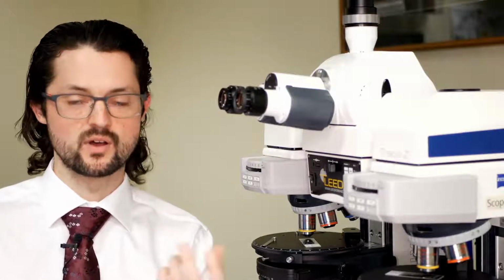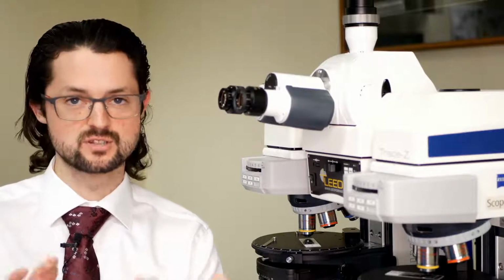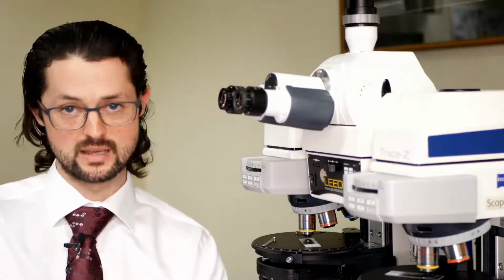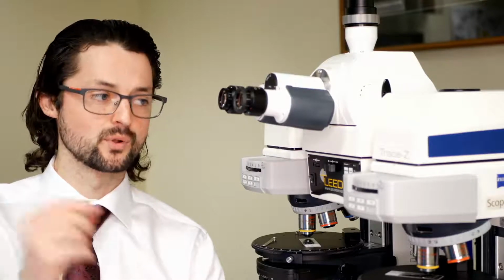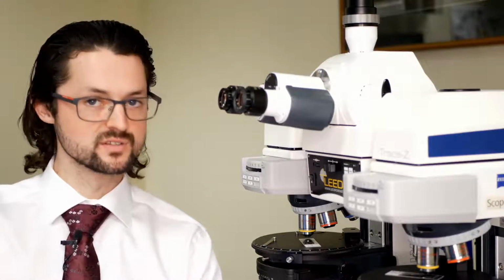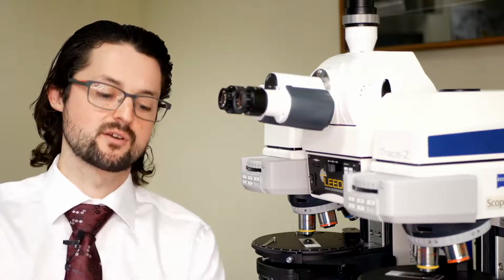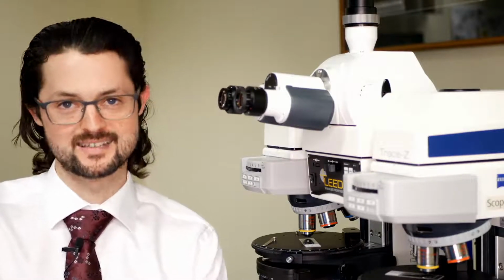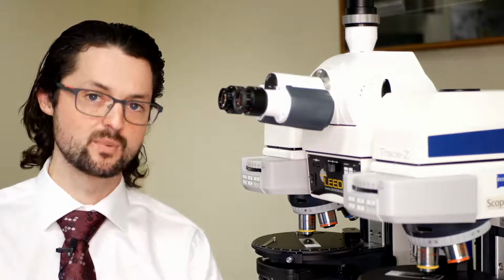So imagine if you're working with automotive paints that are kind of thick, or metallic paints, or things that transmission of light isn't going to move through. The reflected light techniques allow you to do comparisons on those types of samples. And you can even do pole work there. The reflected light pole that we would sell, that we equip labs with, has field stops and aperture stops. You can do Kohler technique on these samples. They're not dark samples, but they don't transmit light, these opaque samples. It just allows you a lot more out of your microscope and capability.